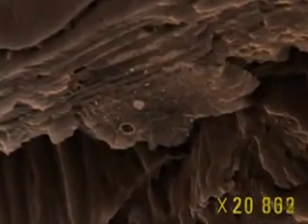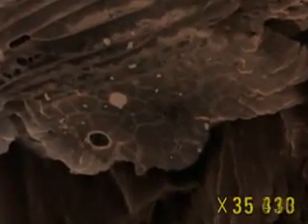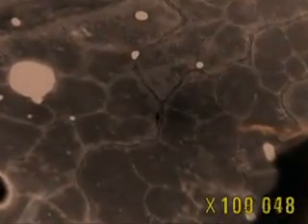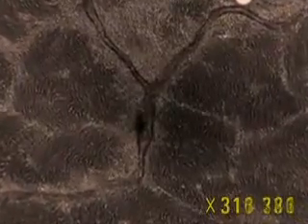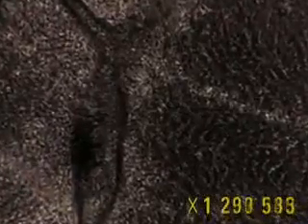The small white spots were caused when the hair was prepared for the microscope. The black groove in the form of a Y marks the separation between three cells. Those rounded shapes inside each cell are spheres of protein fibres. The white flecks inside these spheres are made up of keratin rolled in a spiral. Even at this magnification, it's impossible to see the structure of keratin. Our microscope has reached its limits.